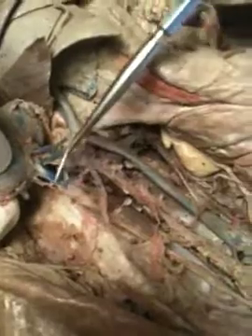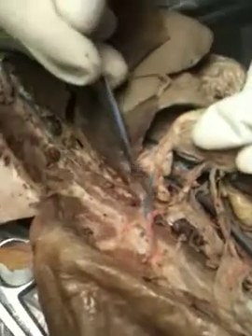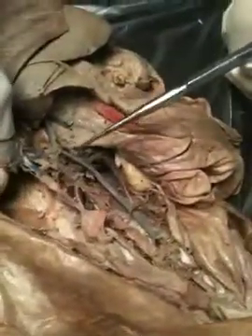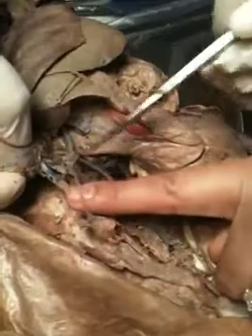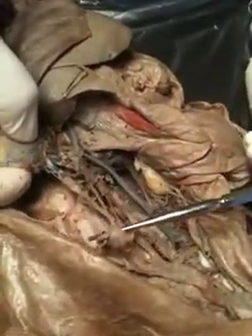Is it the right or left? Yeah, it's the right. Genital? Yeah, the adrenal. Oh, the adrenal one is over here. Oh, it's on the other side? Yeah. That would be the adrenal lumbar vein, which is posterior to the kidney. And then you have this one, genital? We believe that might be the genital vein.